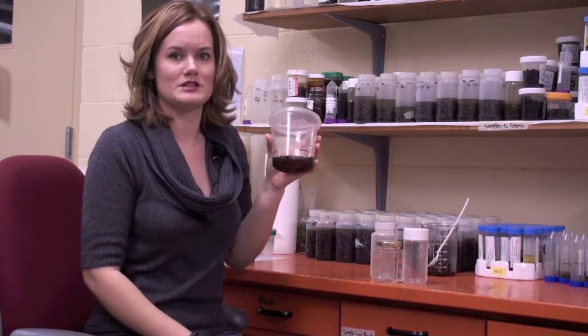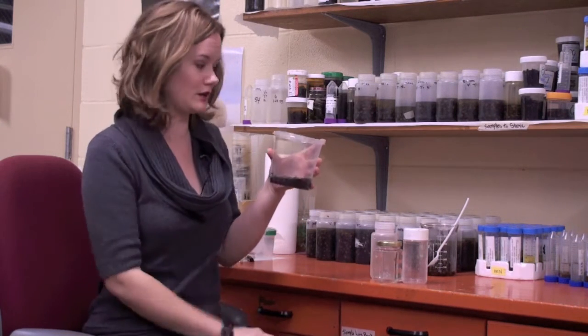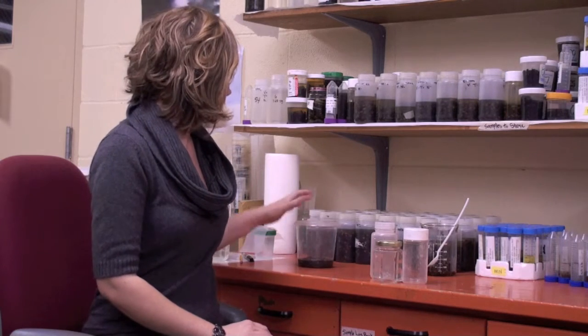These things are used just for a couple dinners maybe, but it doesn't work when you're sending it in the mail. So it will easily pop open or get squished in the mail, and your bees can come out. So that makes it difficult.